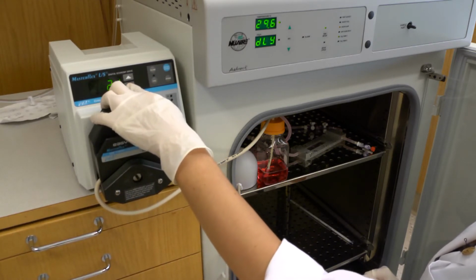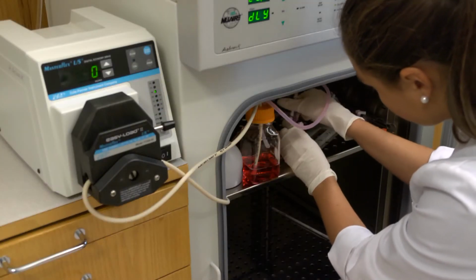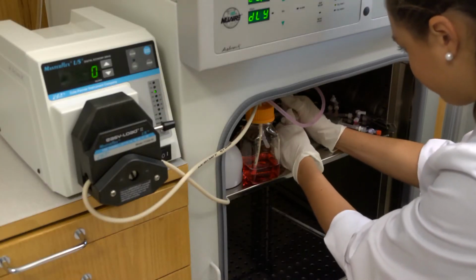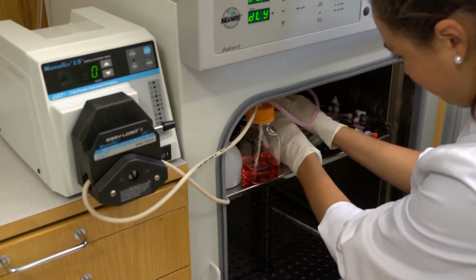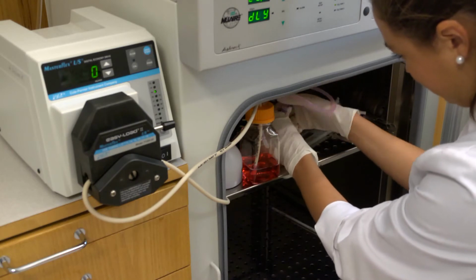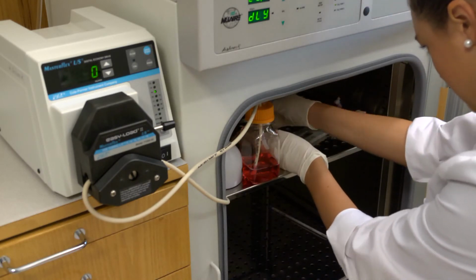Adjust the flow rate to the desired shear stress. During the flow experiment, the flow chamber can be removed from the circuit to image the cells via light or fluorescent microscopy. To do this, disconnect the flow chamber from the flow circuit at the stopcock to stopcock connections.